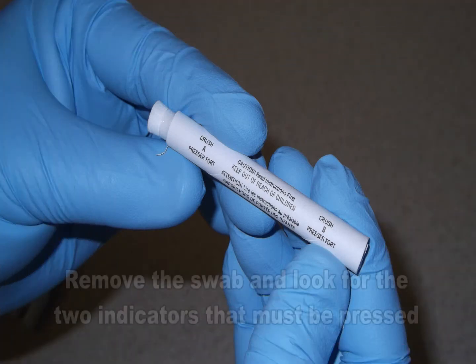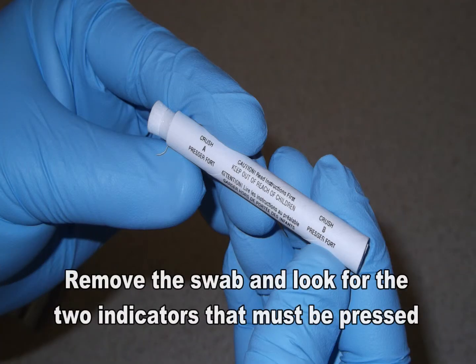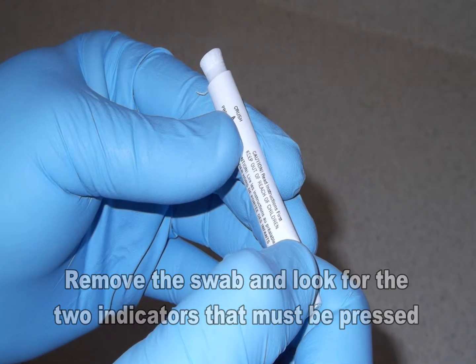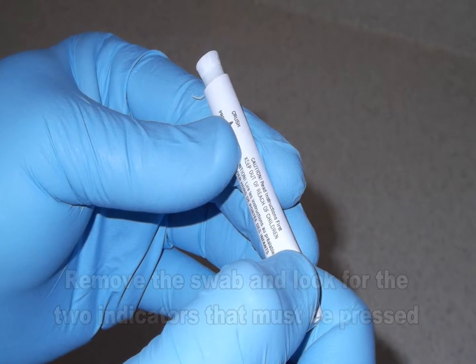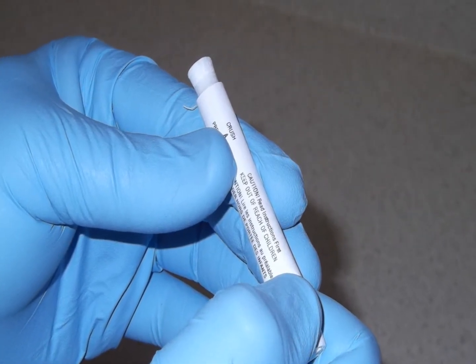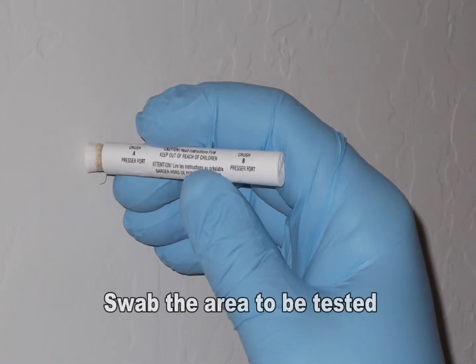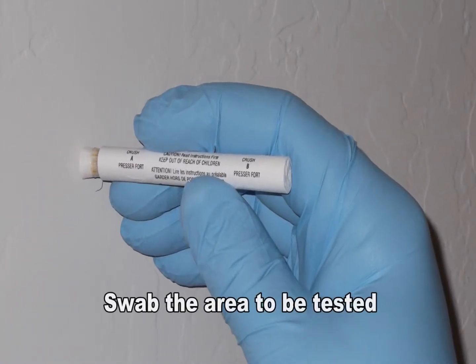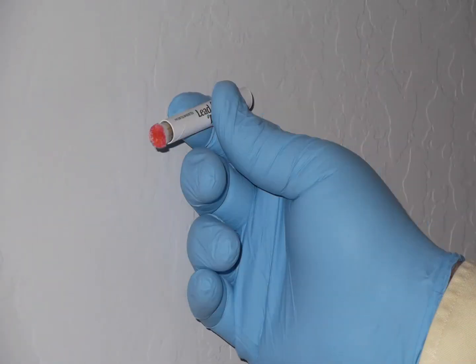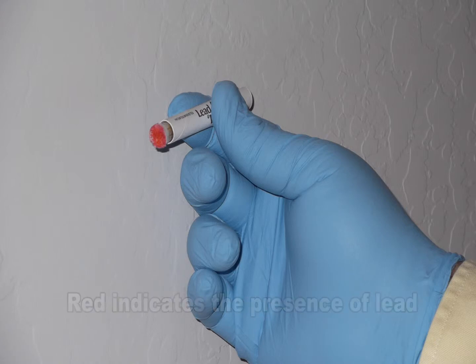To use, first simply remove the swab from the case. On the side of the swab there are indicators to be pressed to activate the liquid solution for testing. Press each indicator in the order written to activate the two chemicals. Then swab the suspect area and look for a chemical reaction. If lead is present, the applicator tip will turn red.